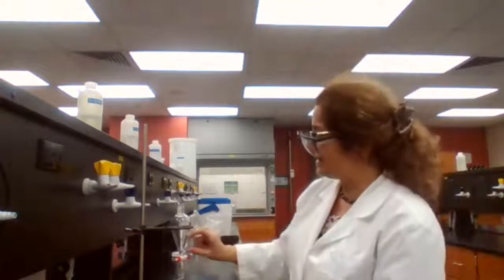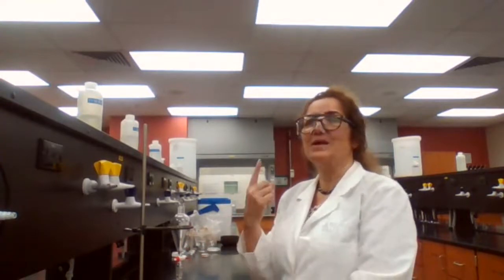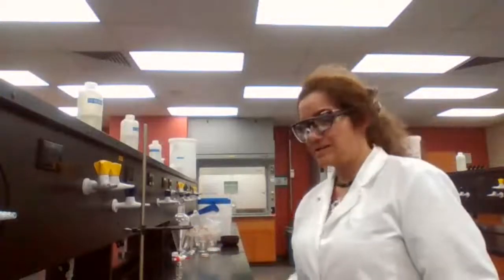So if I say consecutive, am I careful with the last part, the separation? Because if you put, let's say, 10 milliliters of sodium hydroxide and you don't separate, then you add another 10 milliliters of sodium hydroxide to repeat your extraction, basically you are using one extraction with 20 milliliters of the sodium hydroxide. So that is not called consecutive extraction. That would count as one extraction only. So you don't want to do one extraction. You want to do multiple extractions. That's why you have to separate it each time you are adding a new solvent, or extracting solvent.